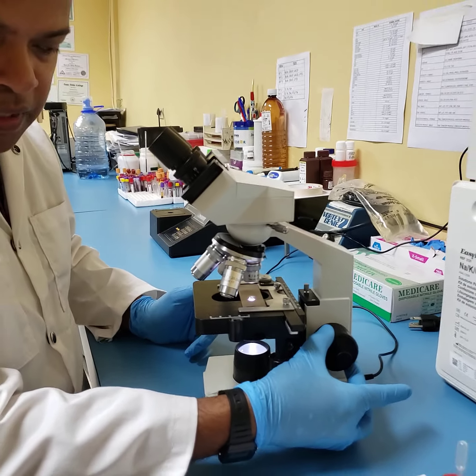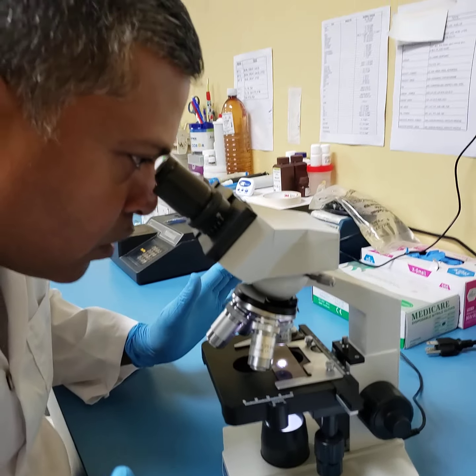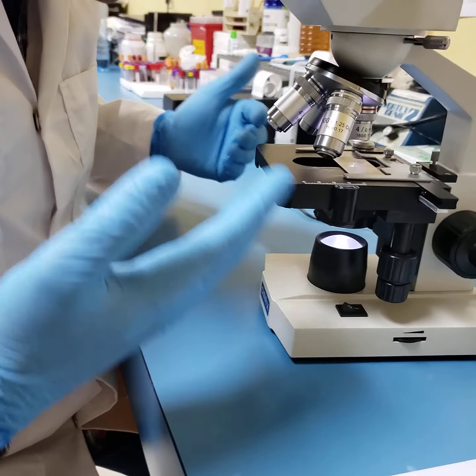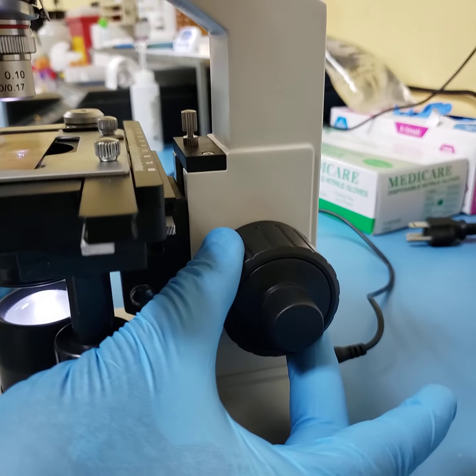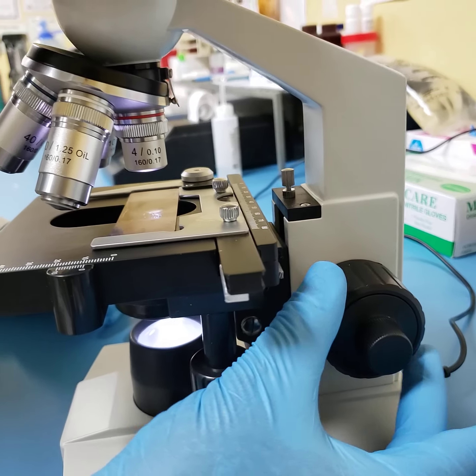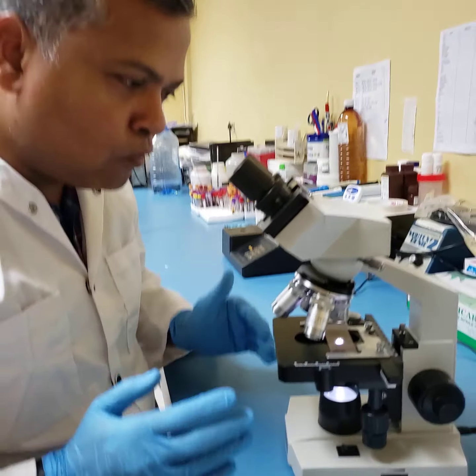So I'm going back to the place of where we were before. Coarse adjustment knob turned and stage brought straight up. I will be seeing absolutely nothing except probably the background color of the smear or the image. All I do now, very importantly, is turn my coarse adjustment knob a little bit towards me, and now my image has come into focus. At this point, the image will be small, but yet it is focused.